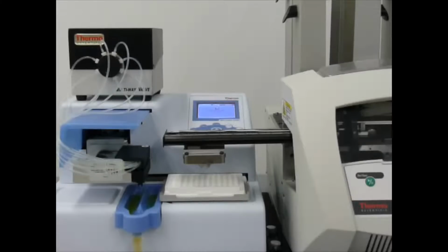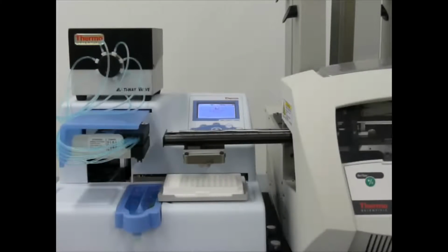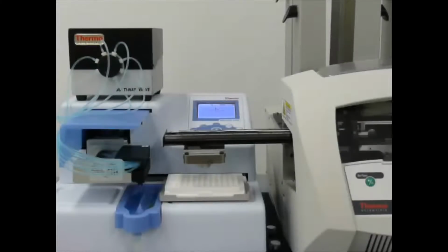And that was going into the even columns. And now you'll see the yellow go away. We're priming with water. And now you'll see blue come through those tubes, which is reagent 2, and we'll have reagent 2 going into the odd columns. And then we have the prime again with water.